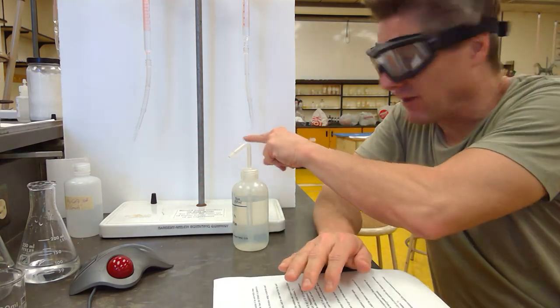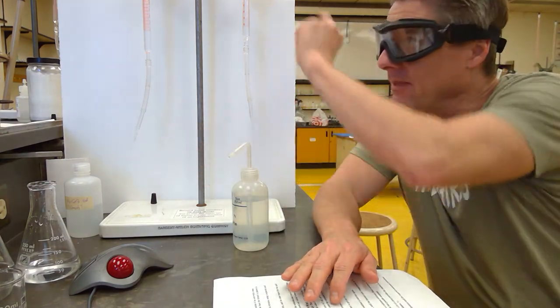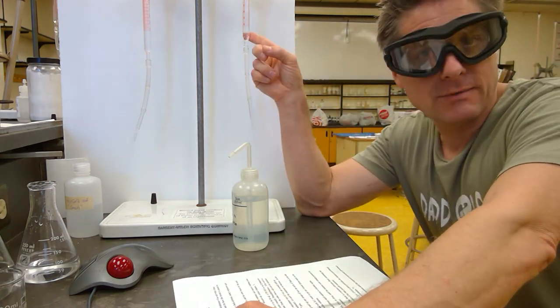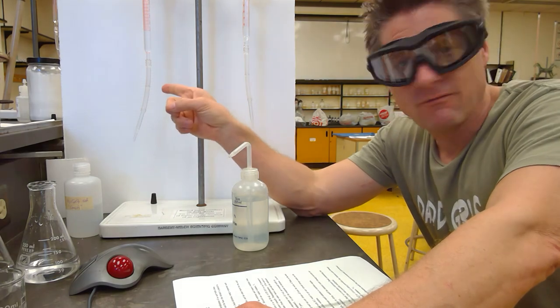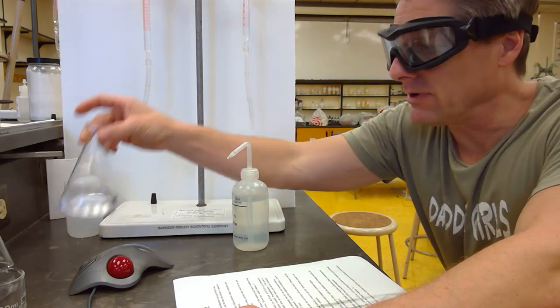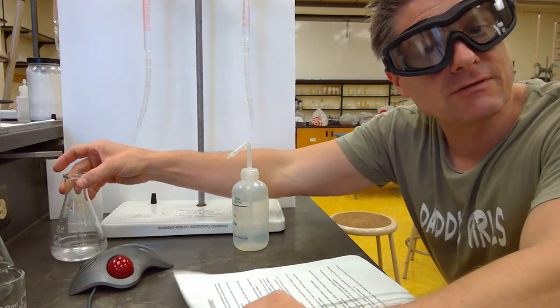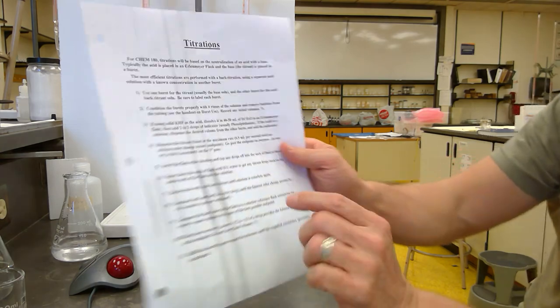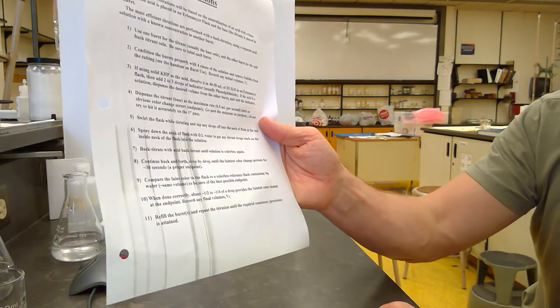And now make sure you're flush at the tips, and then you measure your final burette readings. And if you know the volume and concentration of your base, you know the volume and concentration of your back titrant, and the volume of the original acid you put in there, you can calculate the concentration of the unknown acid and other assorted things, right? So just kind of follow through the steps there. I just kind of walked you through it.